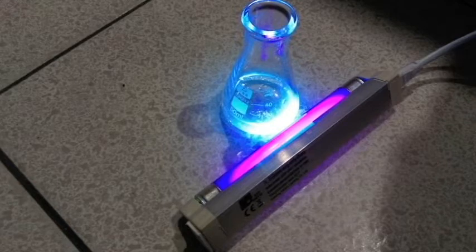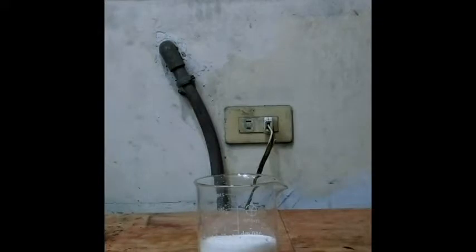Many people have done this reaction before without knowing lots of quantum dots being produced. Okay, let's get started.